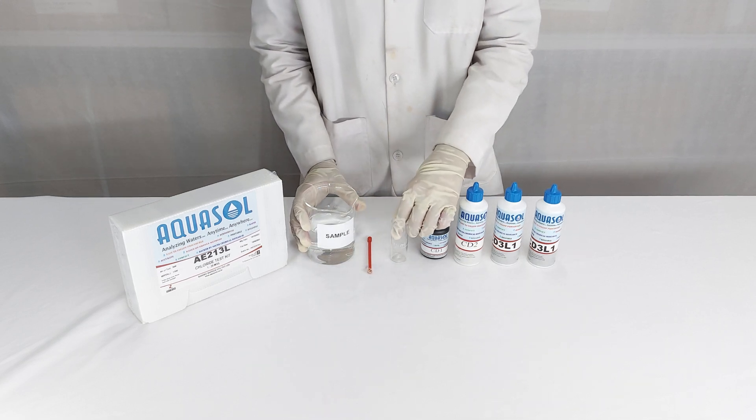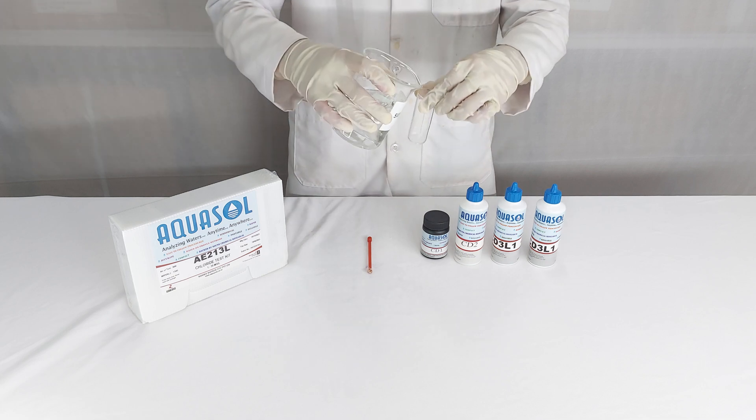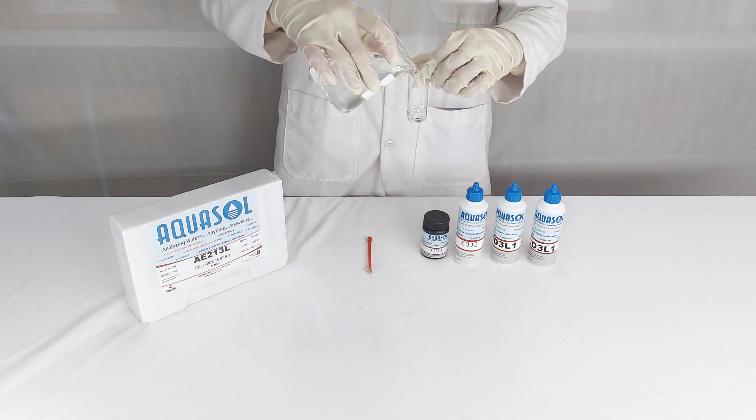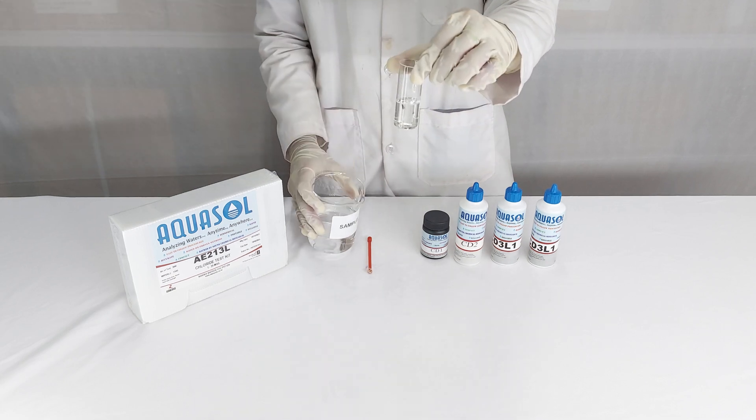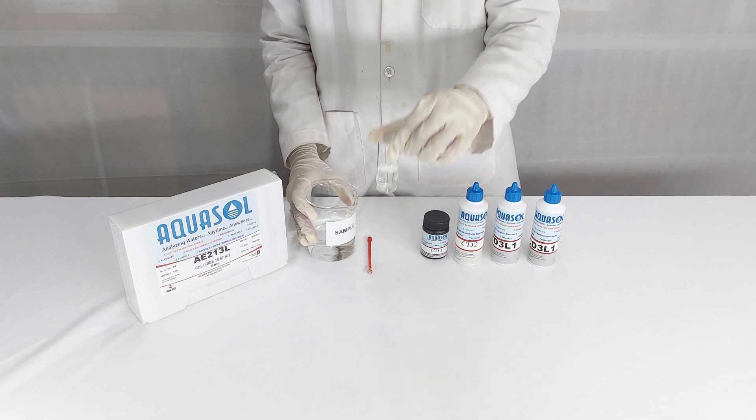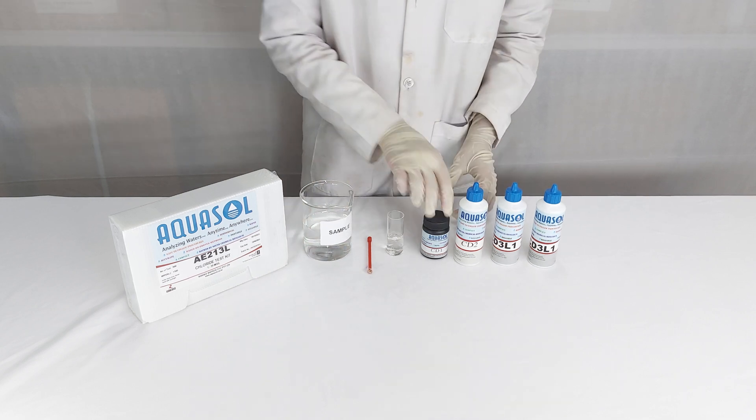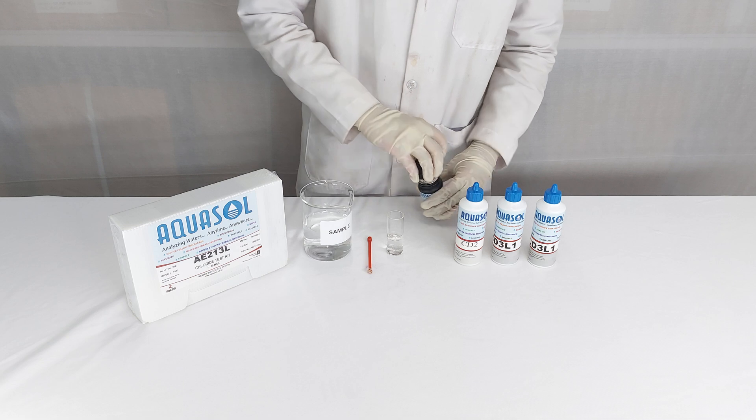Take the test jar and fill the sample up to the 10 ml mark. Now add one spoonful of CD1 powder.